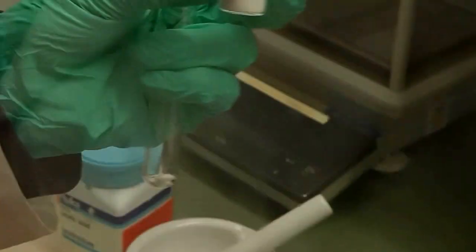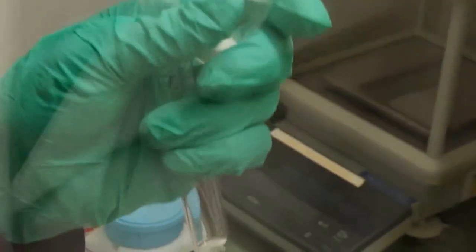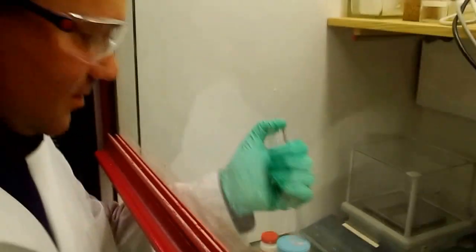Can I see the real cadmium laurate? Yeah, of course. I'm not kidding. Of course we prepared that before, because you need a Schlenk system. You should not do it at home, guys. Alright.